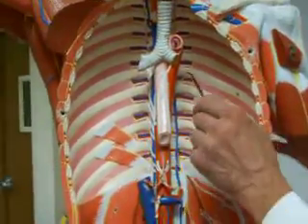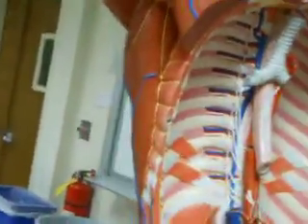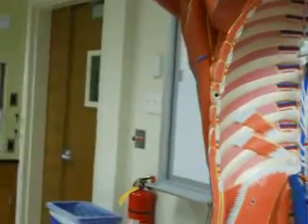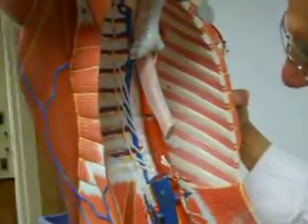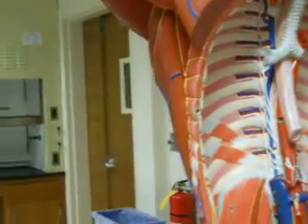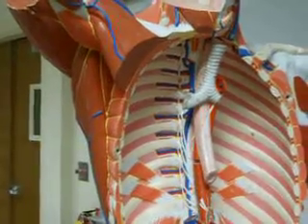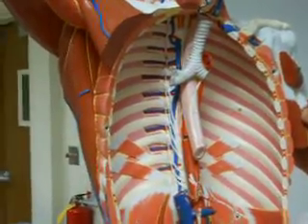Then you should know these blood vessels. These venous vessels over here, which I can't demonstrate in the dissection material. That is this blue one, and this one over here. So the blue one on the right side over here is called the azygous vein. Now that's not in the handout, you have to write that down. A-Z-Y-G-O-U-S.